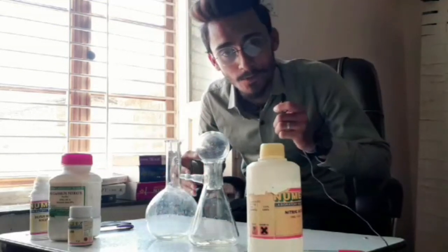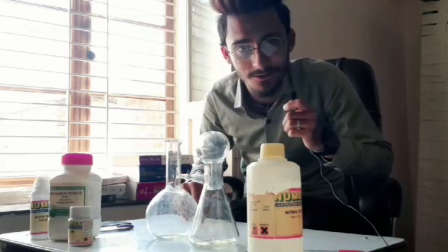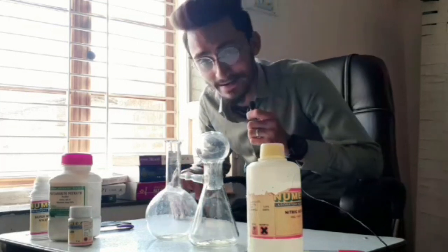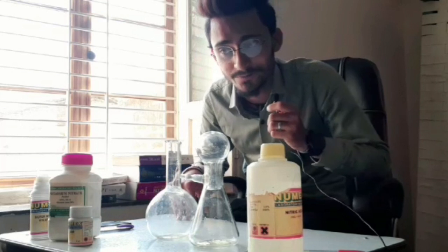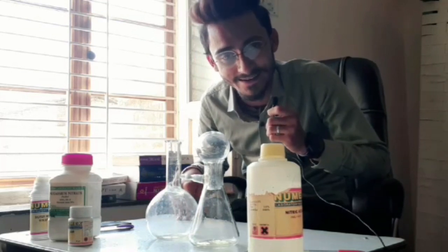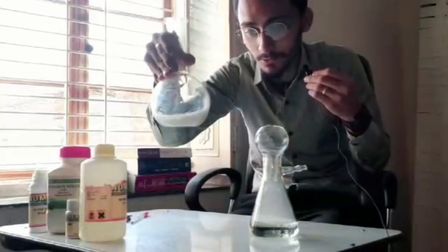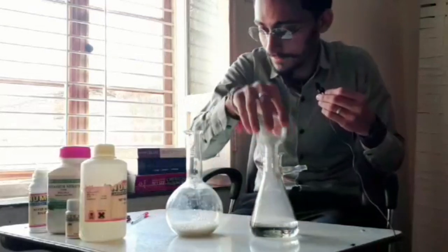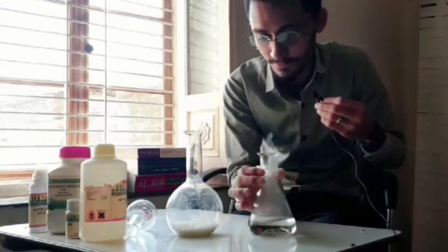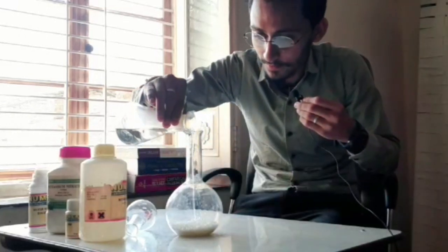The reactions occur with the influence of some gases. I have some chemicals suitable for this reaction and some containers where the reaction will take place. So this is nitric acid, and I take some amount of sugar and pour this acid into the sugar-containing round bottom flask. Let's see what happens.